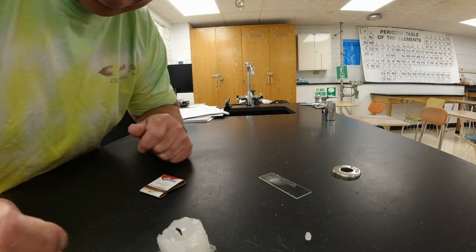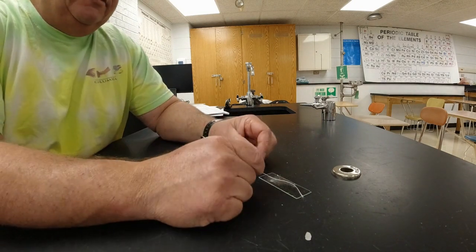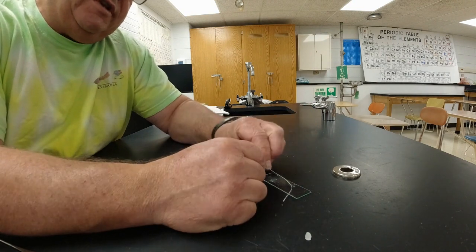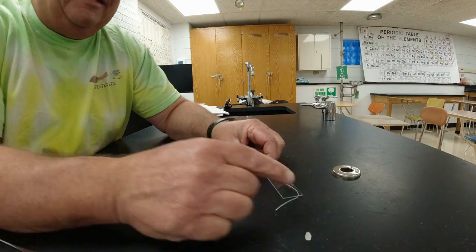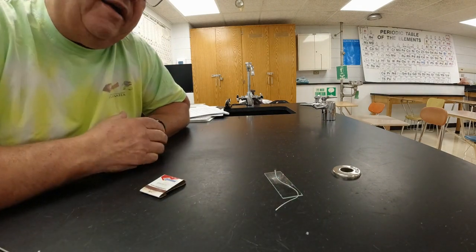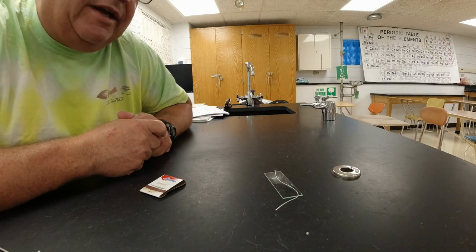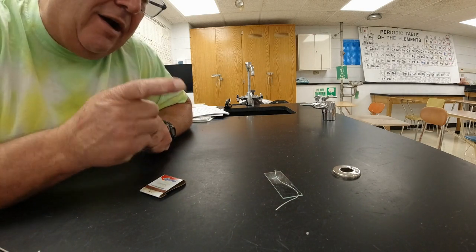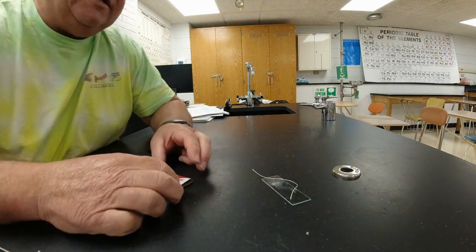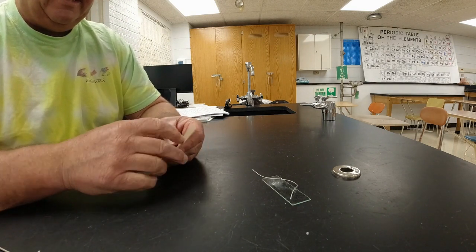All right, here we are in part number 6. Part number 6 says you're supposed to take a piece of string. So there's a piece of string. What part of the candle do you think the string is supposed to represent? All right, so this piece of string sitting here is a candle without the wax. In number 2, we lit a candle that had wax. Now we're going to try to light a candle that doesn't have any wax. So hopefully you guys can see the piece of string here. I'm going to light the end of this thing and we'll see what happens.